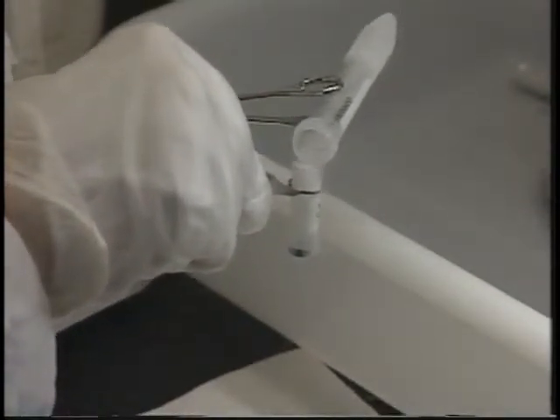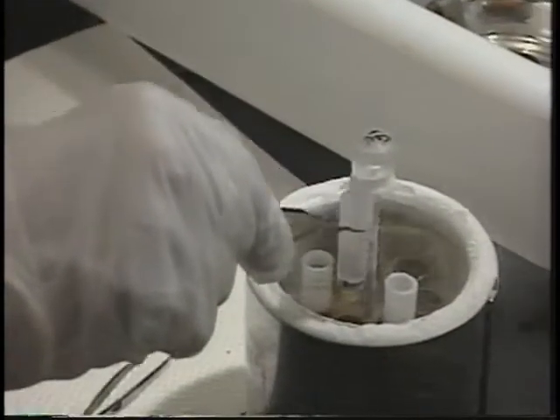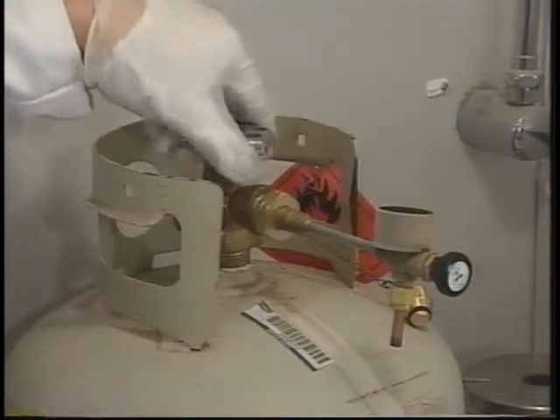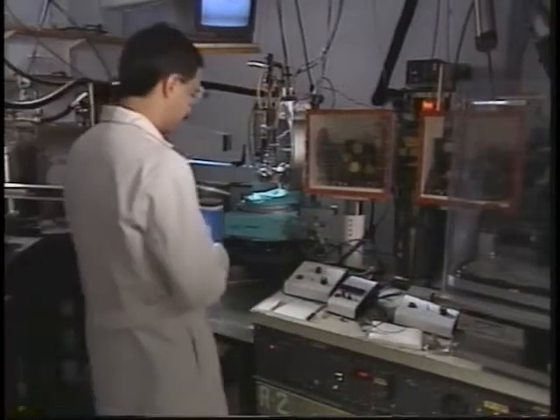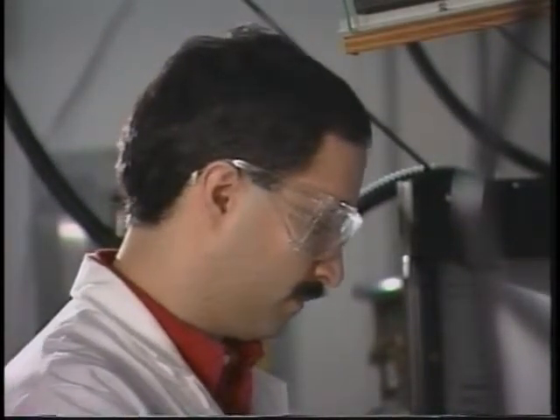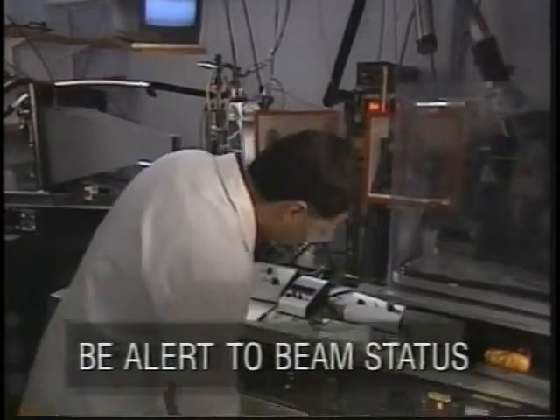But remember, frozen propane has a much higher heat capacity than liquid nitrogen. Contact with skin can result in serious burns. The cutoff valve should always be closed when the equipment is not in use. Routine operation of the X-ray diffraction machine presents few hazards. Still, it's important for users to be familiar with the safety requirements and proficient in its operation. At all times, Yusuf is alert to the on-off status of the beam.